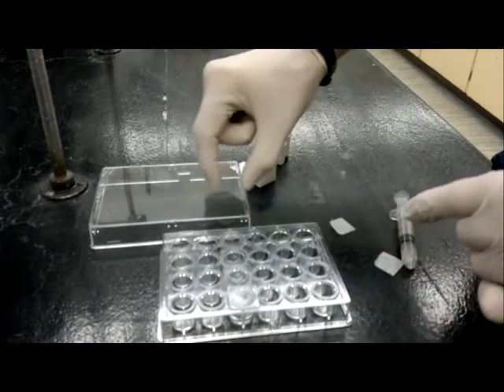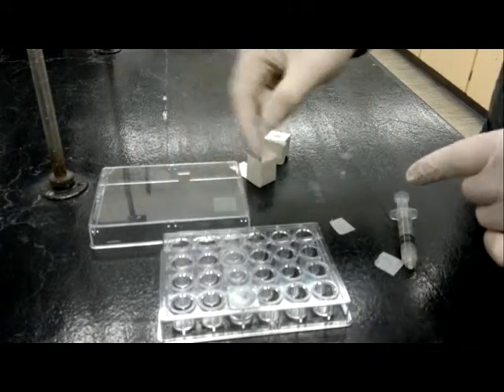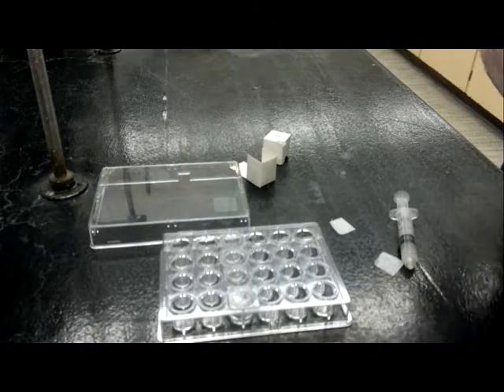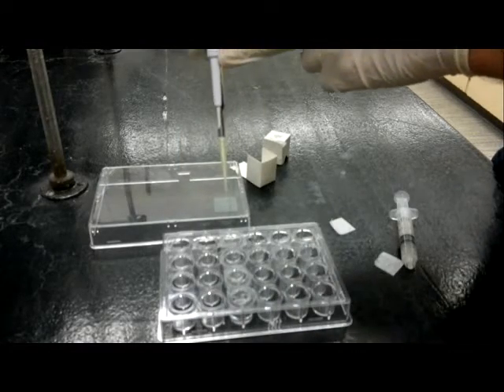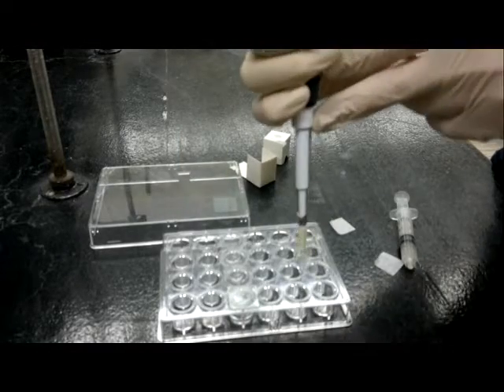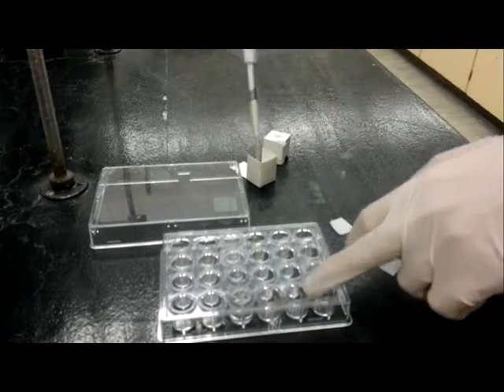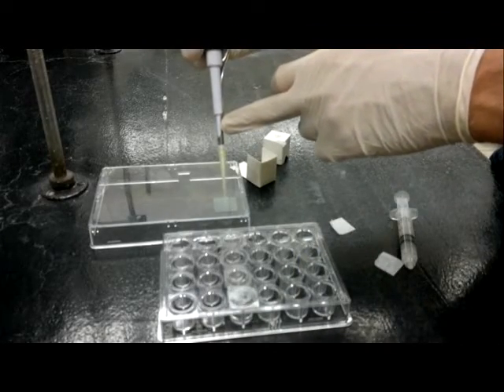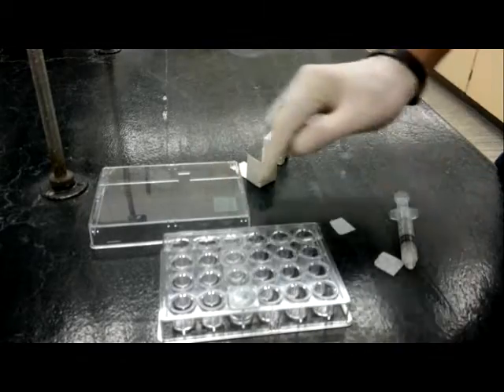So what you're going to end up doing, probably the easiest place to assemble your drops is on top of the tray. You'll pipette your lysozyme solution. You can then pipette some of the precipitant solution, the equal volume, 4 microliters each, to create a drop in the middle of your cover slip.